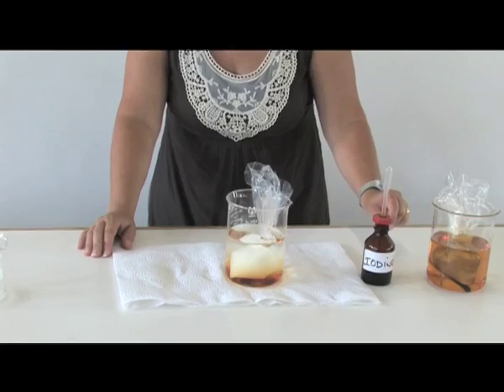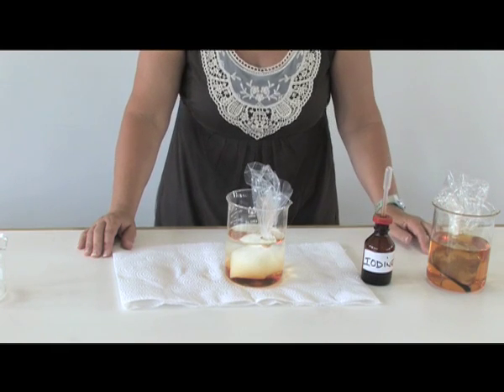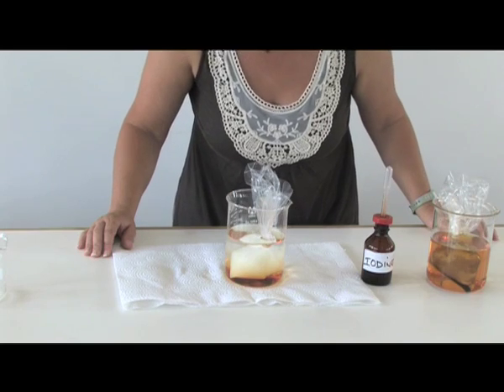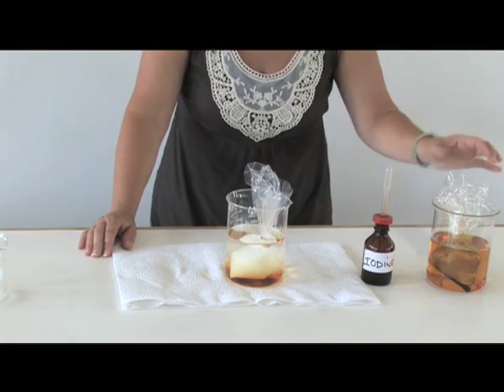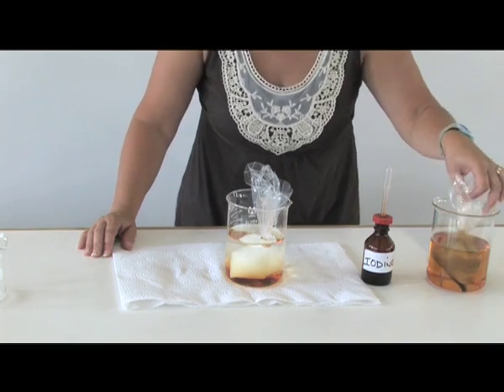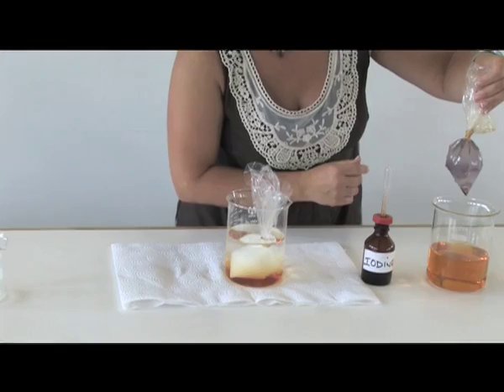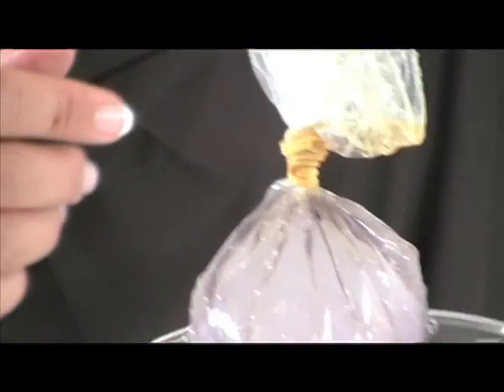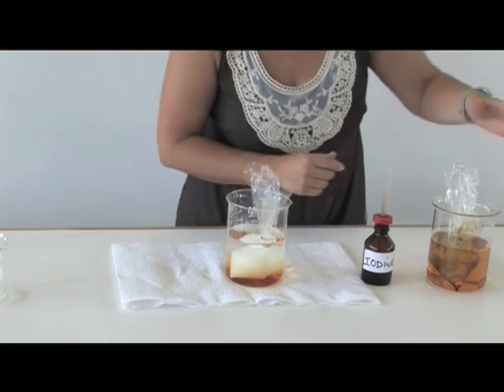We can prove that the iodine molecules have indeed moved, and we see the positive test for starch because — if we take this out — we can actually see that it has changed to blue-black. The longer you leave it in the solution, the greater the result.